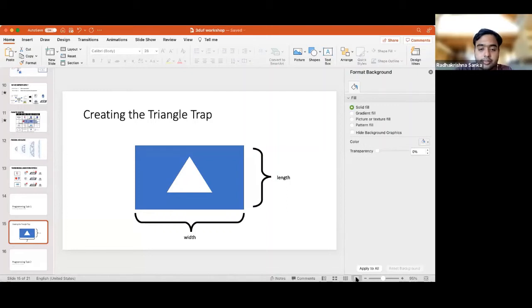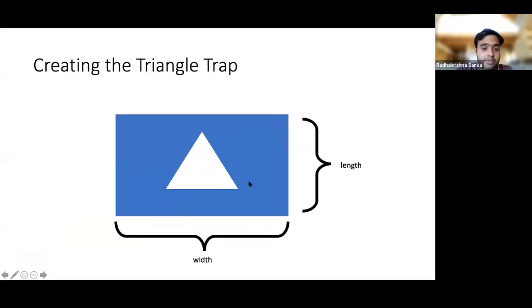in terms of how do you add a UI component? Because so far, what you all have seen is how easy it is to quickly add a new component to make it work for your own special case. So I'm going to go here. Let me share my screen and then let's go into this. So now that we did this, we added a new triangle trap, yay.